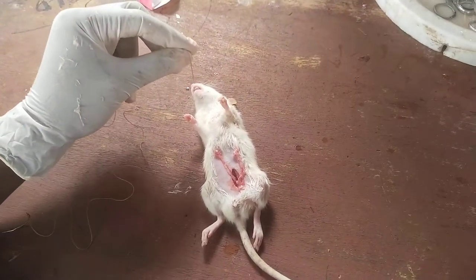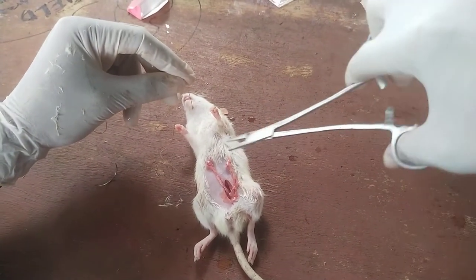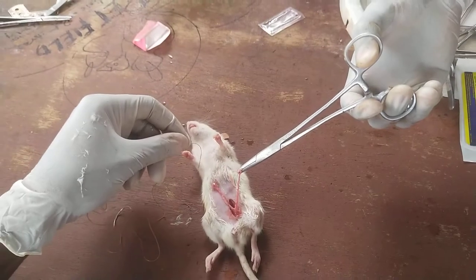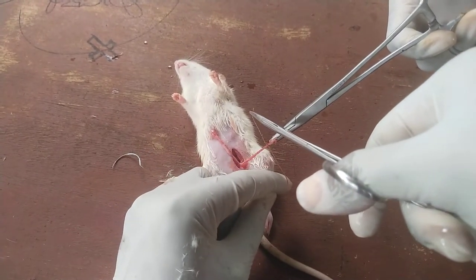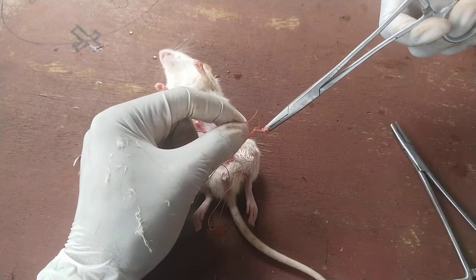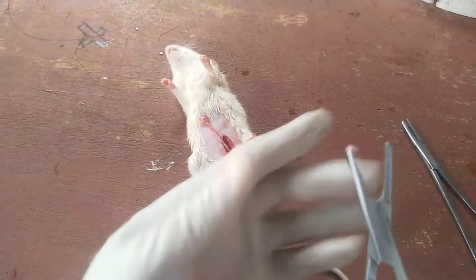We proceed to the next step of ligation — tying off of the ovaries. I will need help from an assistant who will hold the ovary while I do the ligation. It's not a very difficult procedure, but you need to know what to do. Tie a second time to be sure it is totally sealed, then cut. That's the ovary — embedded in fat.